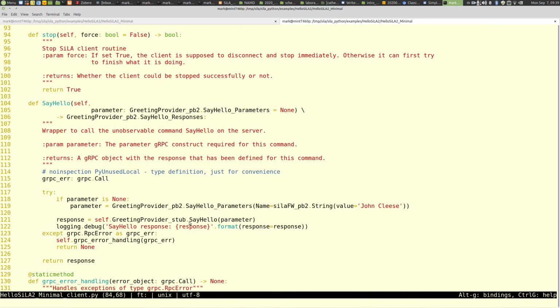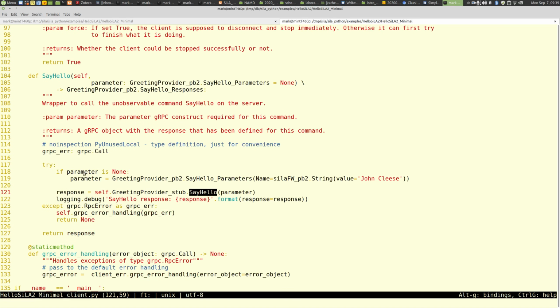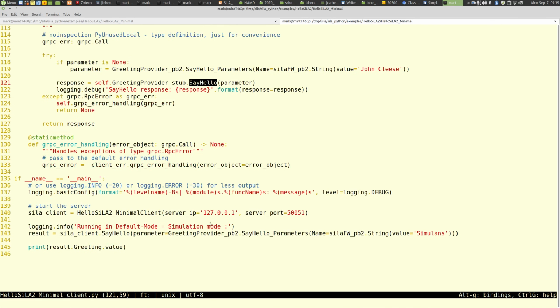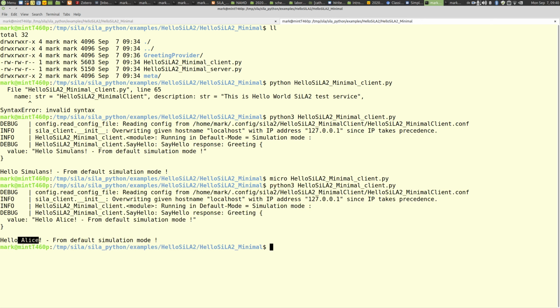And the actual call happens here in this SiLA say hello class. We wrapped this call, this remote procedure call. This is the actual call here with a parameter. This we wrapped in a class, also to handle errors here. Then you can also see how error handling happens. And if no parameter is provided for this call, we provide a default parameter. The actual call happens here. Say hello. This is the call, and this is the parameter we send. So if we change this, for example, to Alice, a different name, and save it, and restart the client, then you see here it replies Alice.